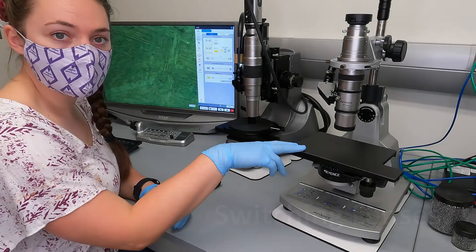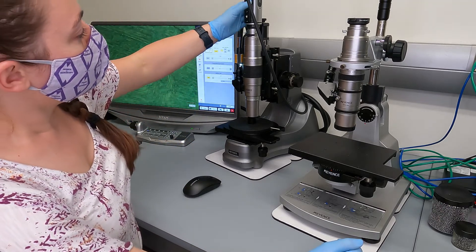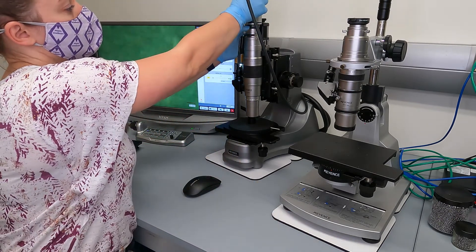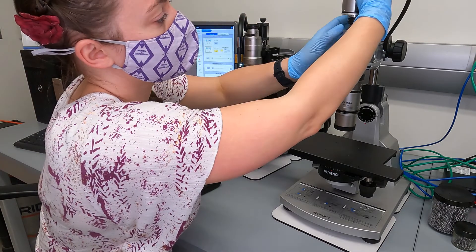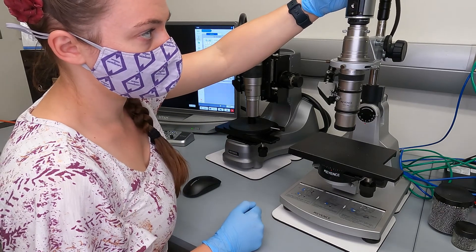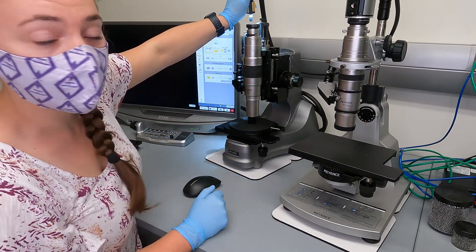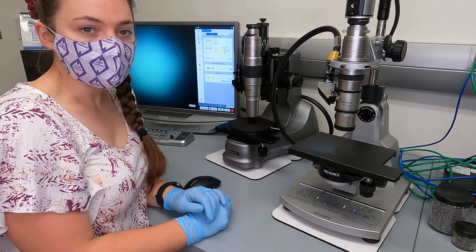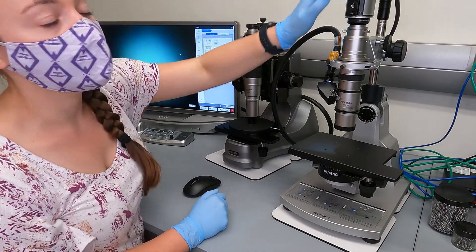If you want to switch lenses — going from the automatic stage to the manual stage — you have to move the camera and the light, same as before. Move the camera by clicking down the little latch, then rotating the camera so the solid white dots align, pulling straight up, moving it over to the other stage, lining up the solid circles, and twisting until you hear a click — then stop. The light is similar except there are no latches: just pull it right out (it's very bright, so don't look straight into it), then slide it into its holder on the other side. If you're using a lens without a side fiber optic attachment, all you need to do is move the camera and the light comes from the camera itself.